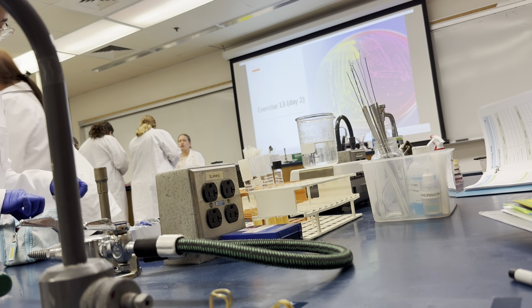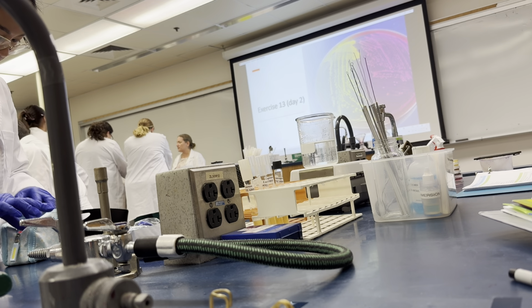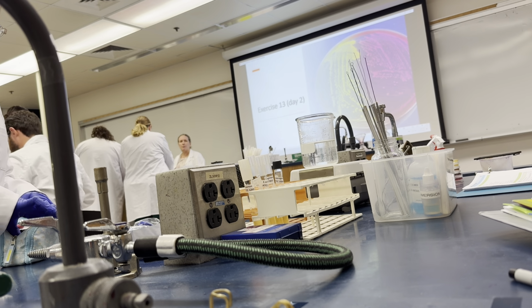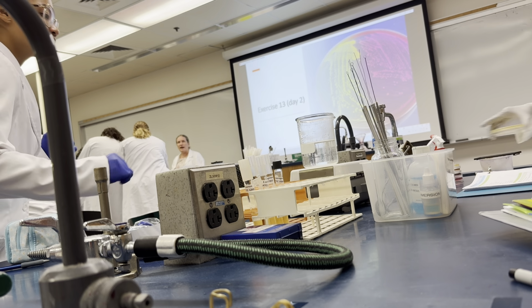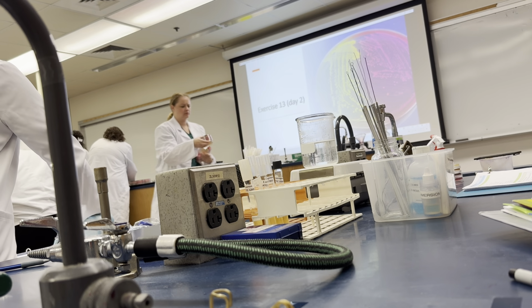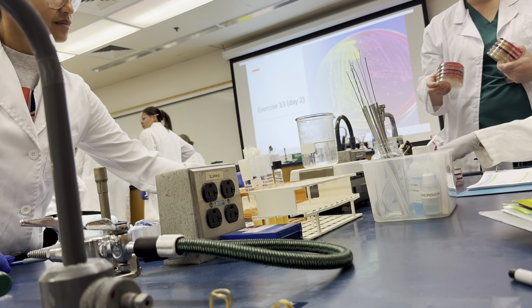What I want you to do, because right now I believe they're separated by organism, is separate them by media. So we should have 5 stacks of 4. Right now you probably have 4 stacks of 5.